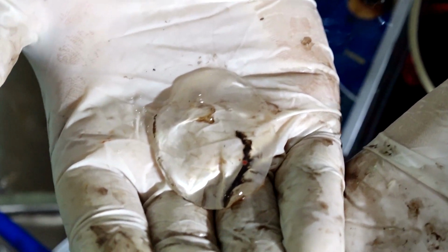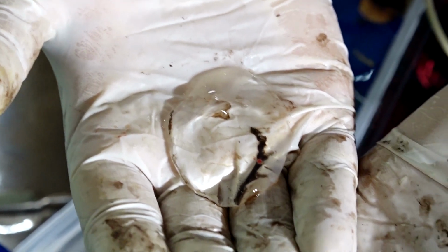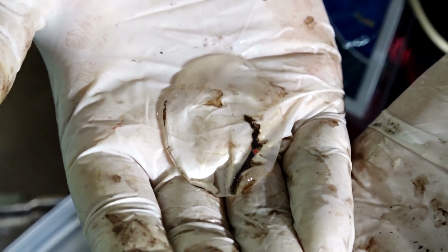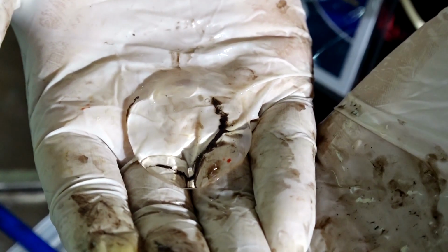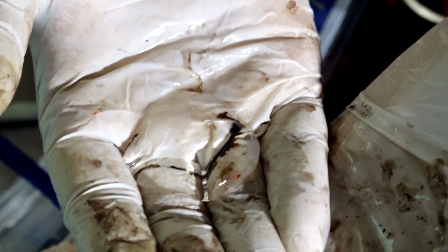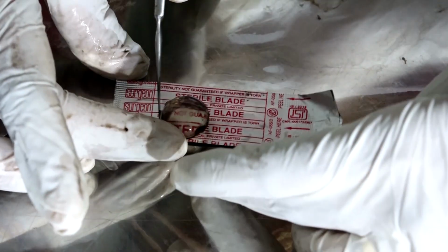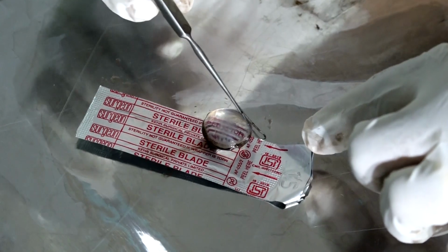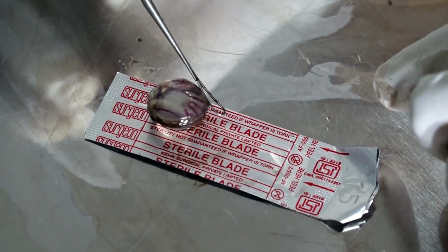And above the cornea, what is the transparent structure? Over the cornea. Don't cry, tell me. Tears. Tears also are transparent. They all take part in allowing the light to go in and form an image on the macula. So did you follow? Any doubts? Was it interesting? Okay. Would you like to see it again?